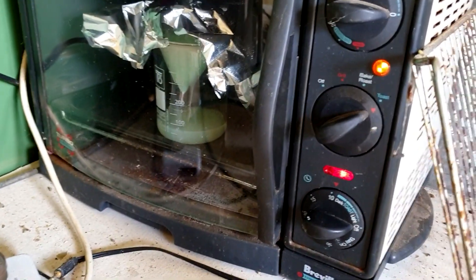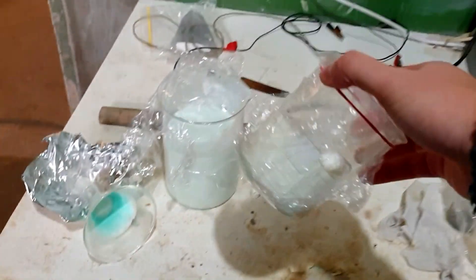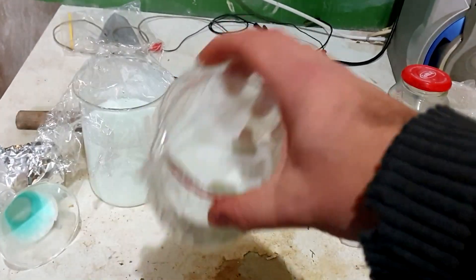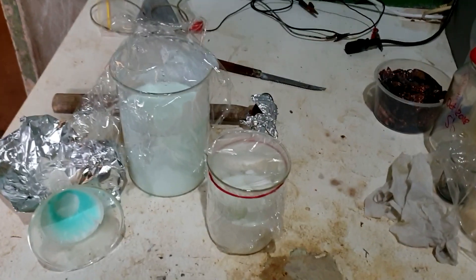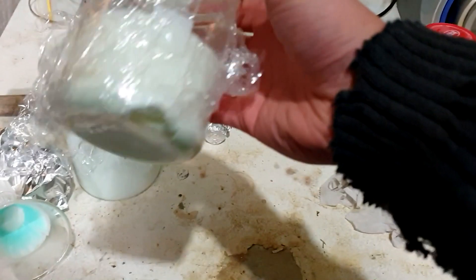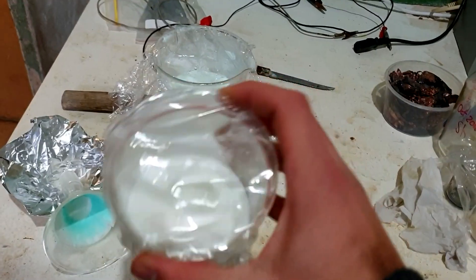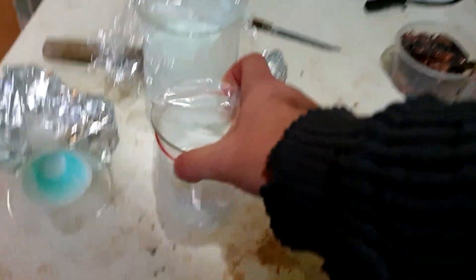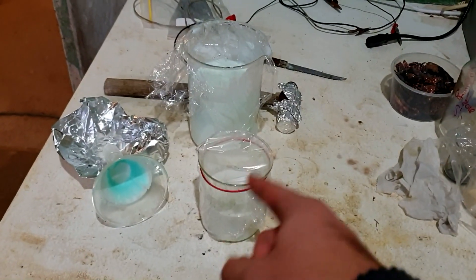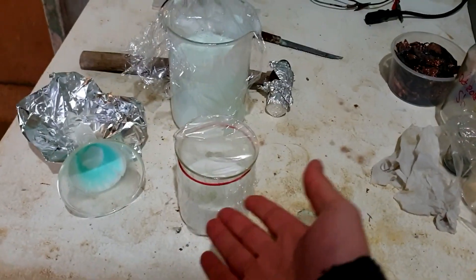Just hot filtering in the actual oven because why not — it's just on low heat, so all the glass stays hot and everything keeps filtering. Alright, this is the stuff that came out of the hot filtration. You can see it's slightly less green, so I think we've removed a lot of the particulates, but really it's just like another solid lump. There's still heaps of water in here, and heaps of glycerin. We really need to get this to a point where we can filter it. Water is a terrible solvent for this — it dissolves really well hot but then really poorly cold. I reckon if we use ethanol we might have more success. I'm going to try and dissolve it in ethanol and see if we can actually get it to a point where we can filter our solid out from everything else in solution, rather than just having a big block.